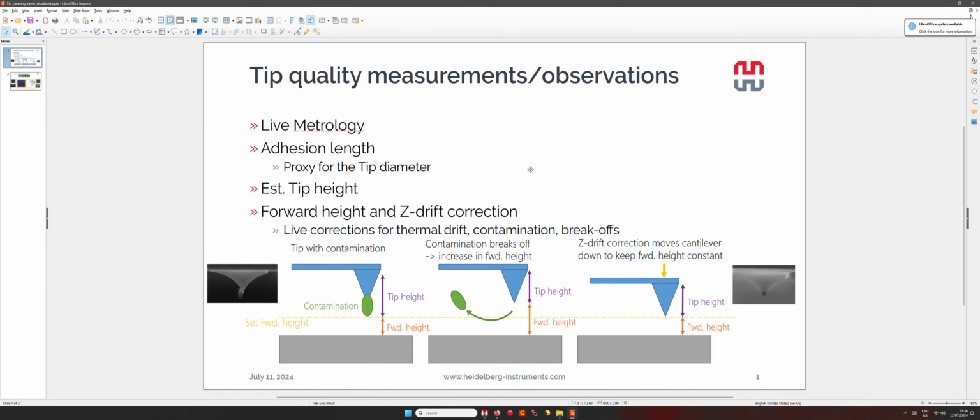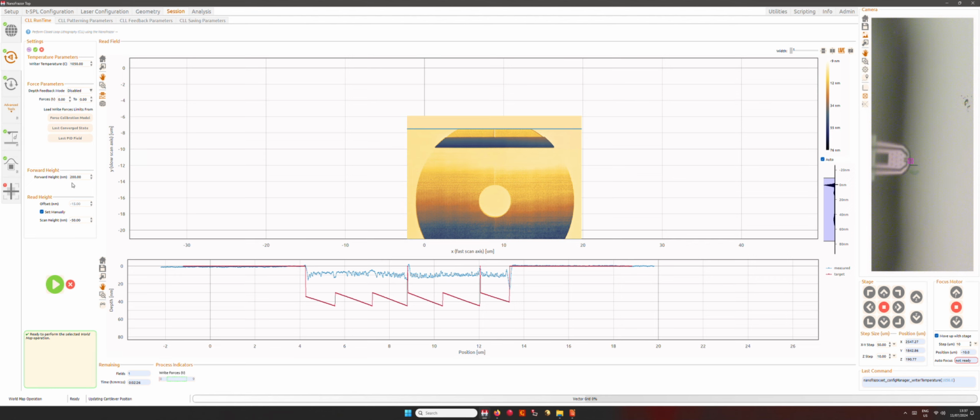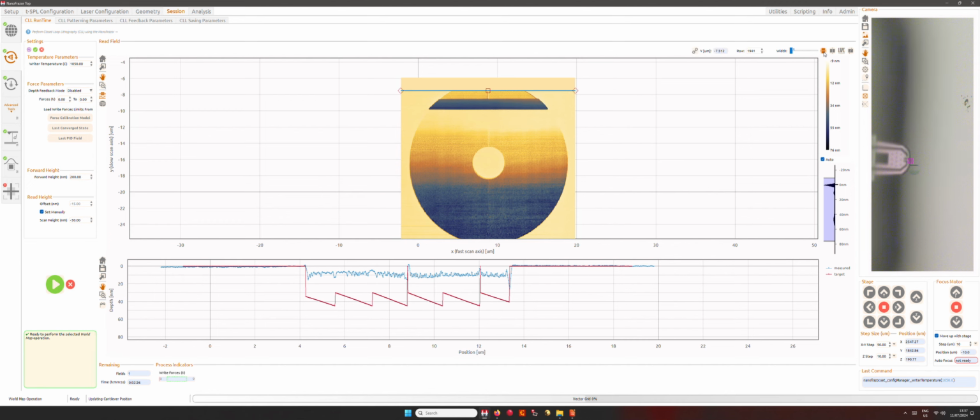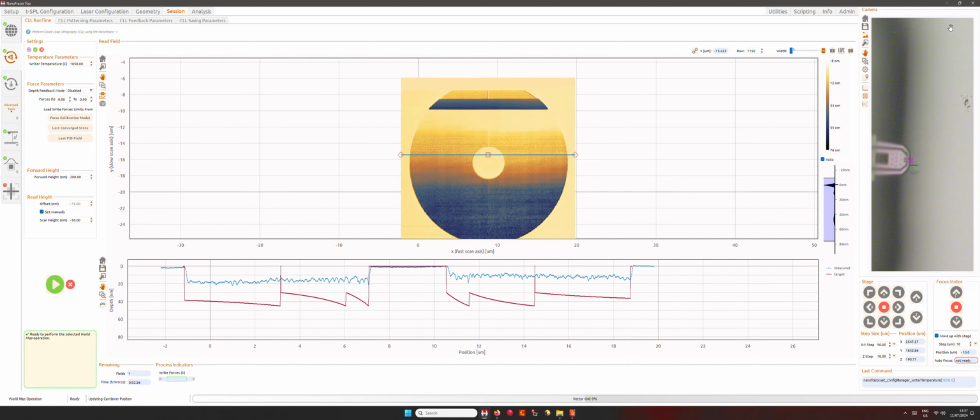So when we write, here I have the slide that explains the tip quality measurements and observation. So basically when we write, we can accumulate some contaminations, or we can have some blunting, and we can have also some thermal drifts. So these phenomena can alter the effective tip height. Therefore, the forward height is not the forward height that we set from the software, because let's not forget that the forward height that we set here is a fixed value. So this is going to be kept for all the lines that we write.